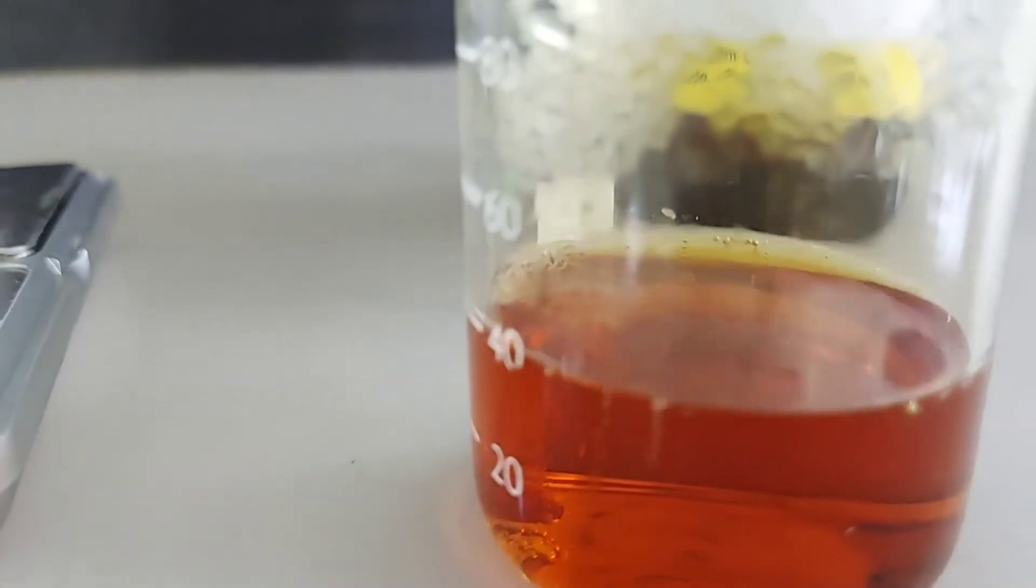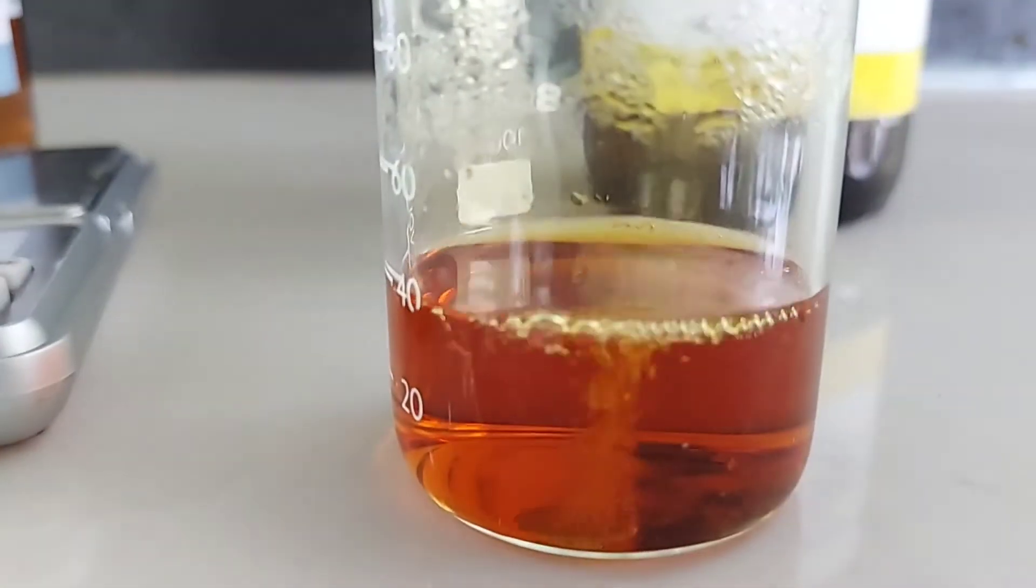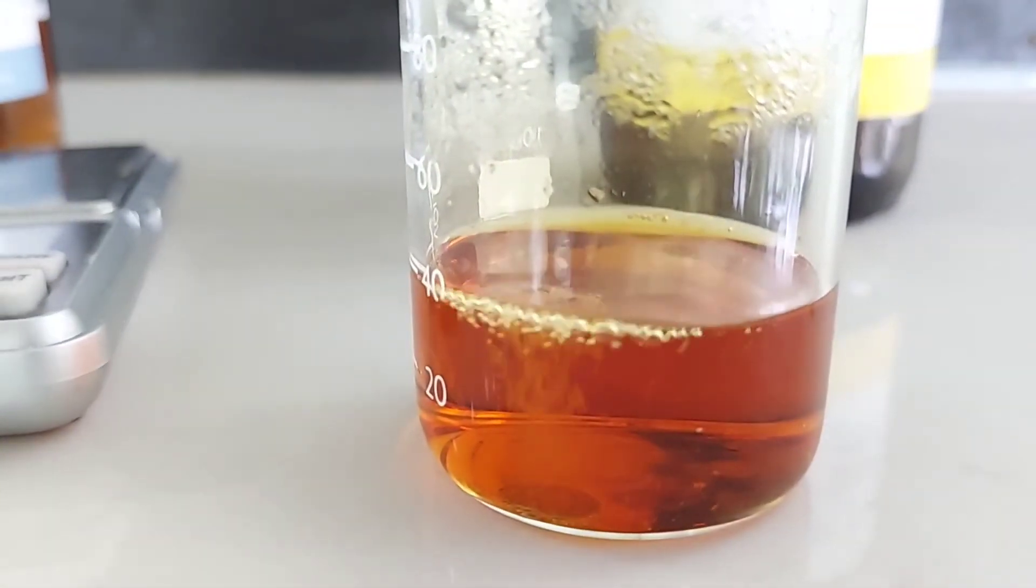Hi friends, welcome to Parallel People YouTube channel. Today we are going to make a wonderful liquid called Aqua Regia that can dissolve both gold and platinum.